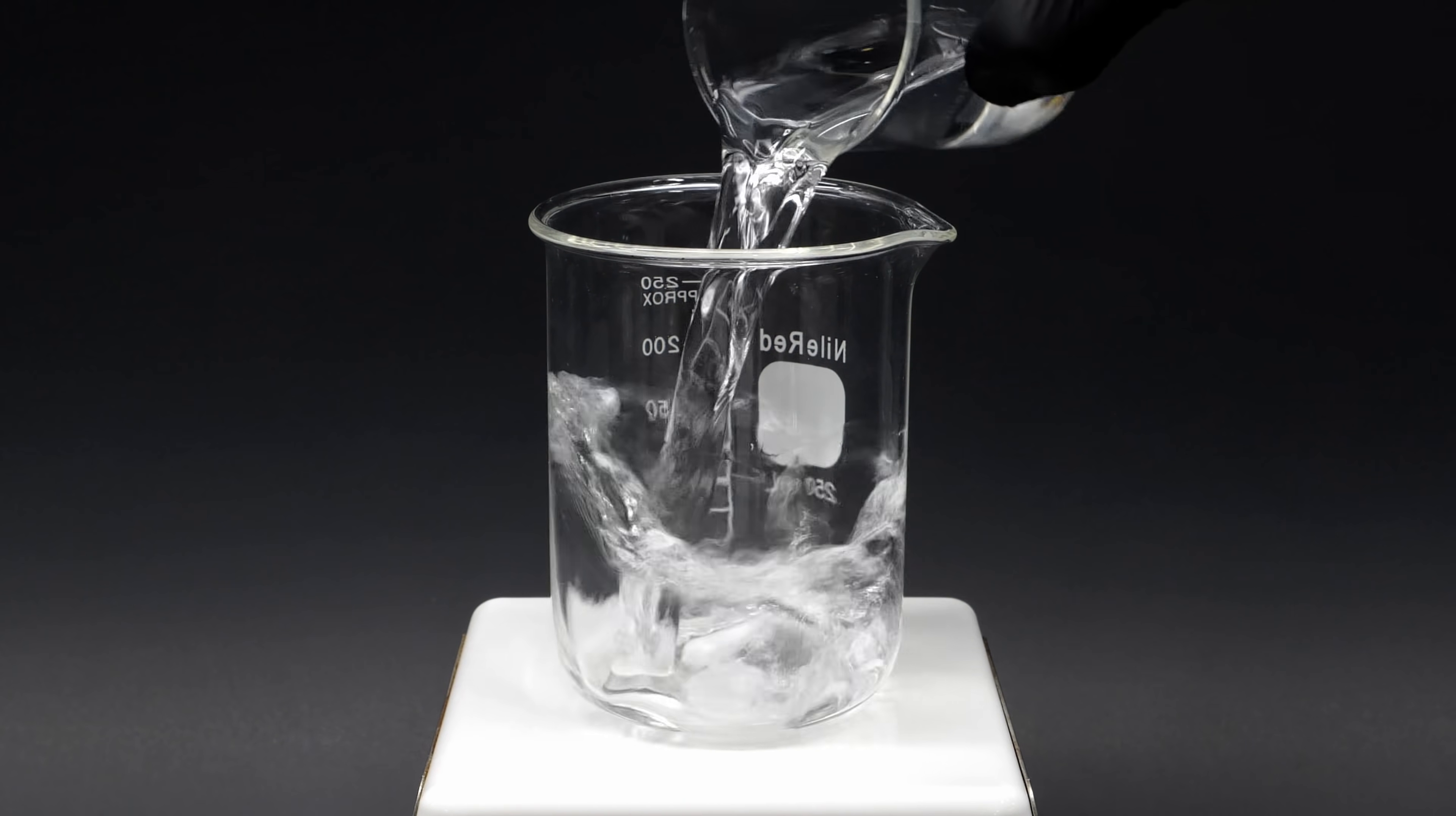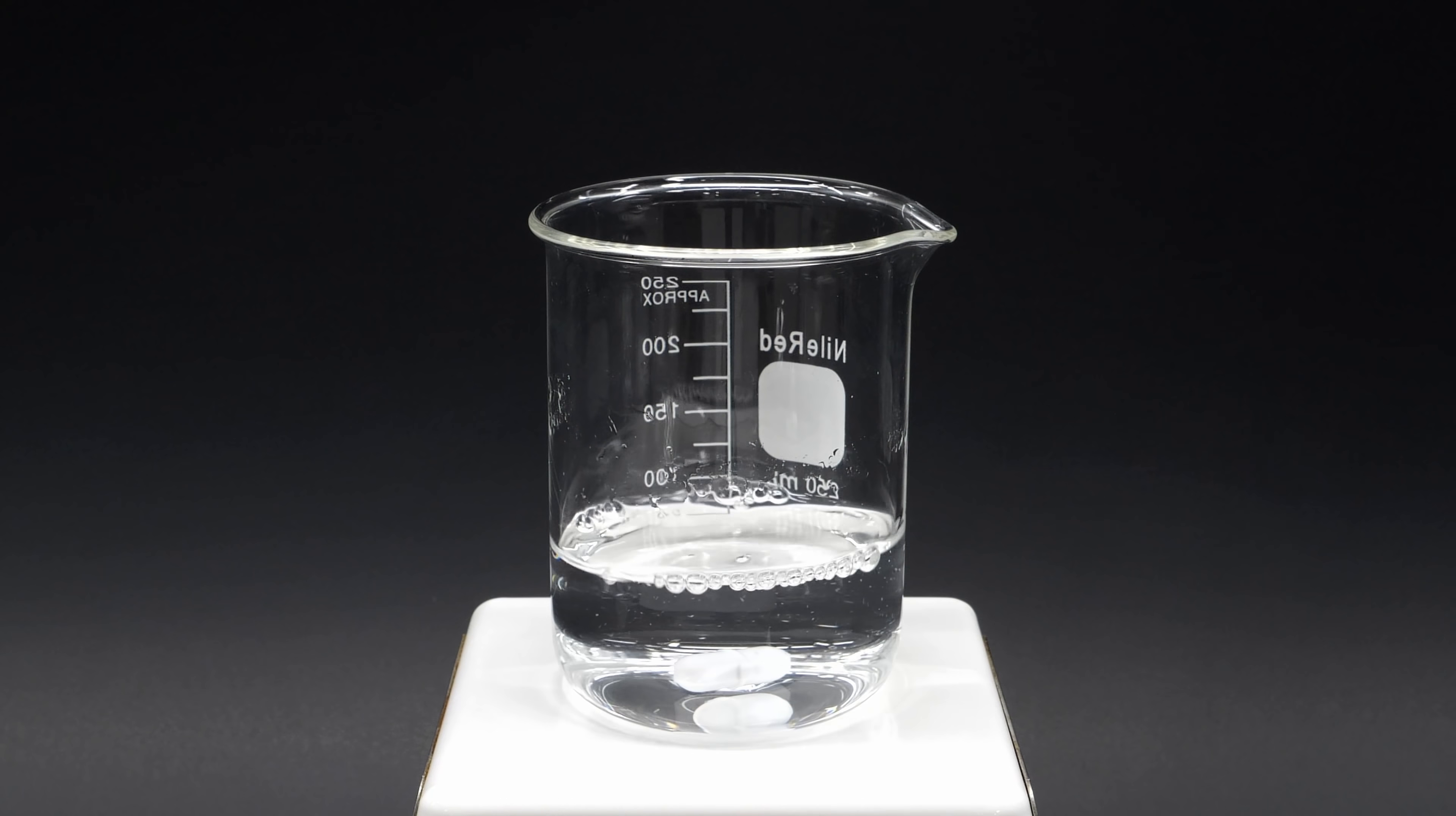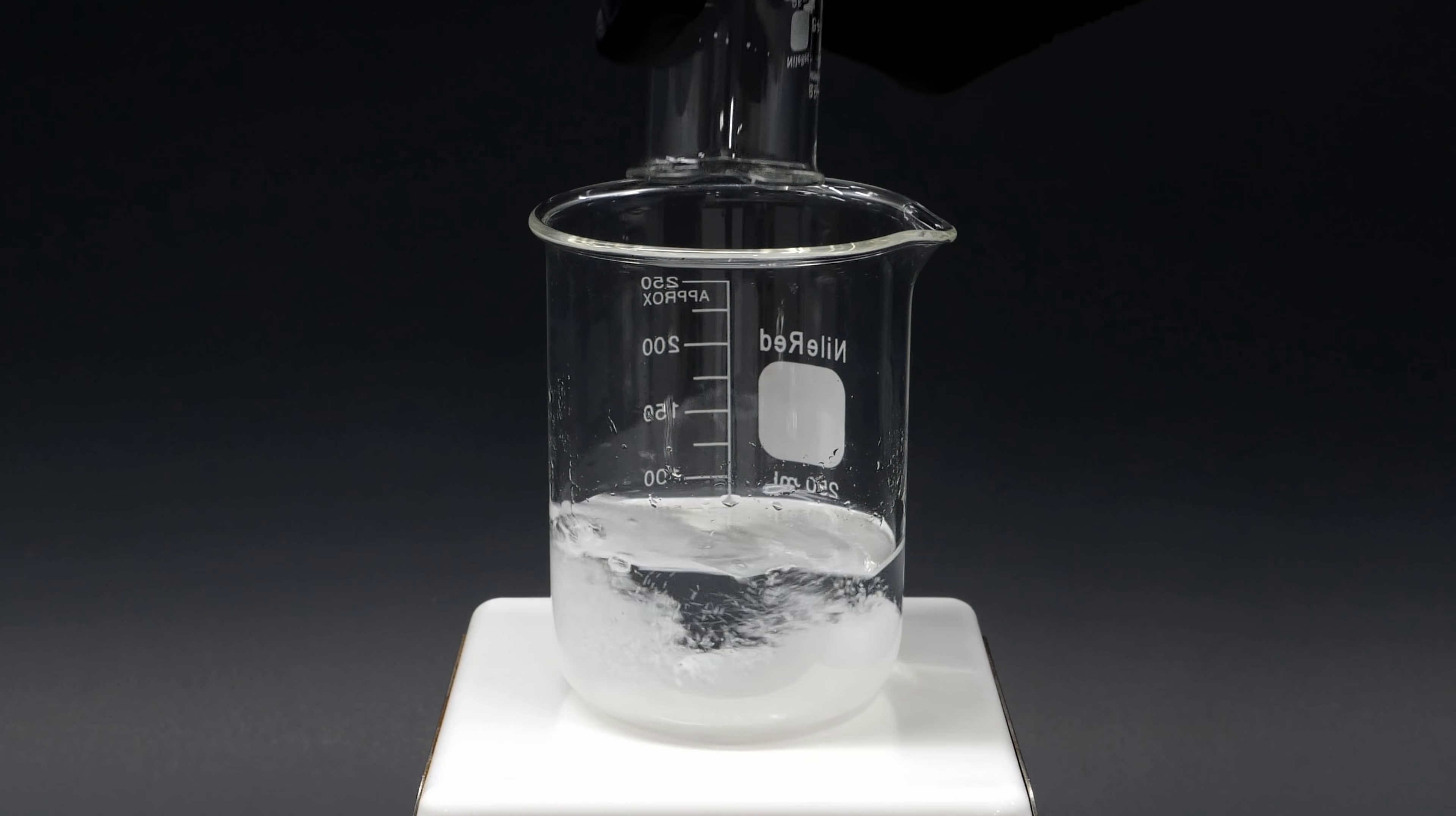For this mixture, I'll start with some water, and I need to dissolve some sodium hydroxide drain cleaner.